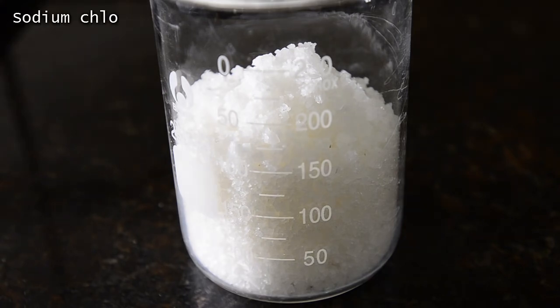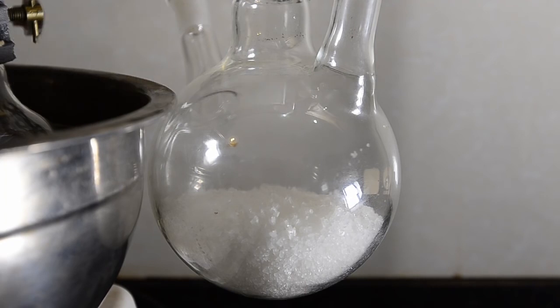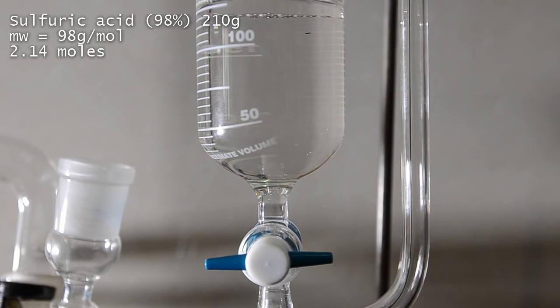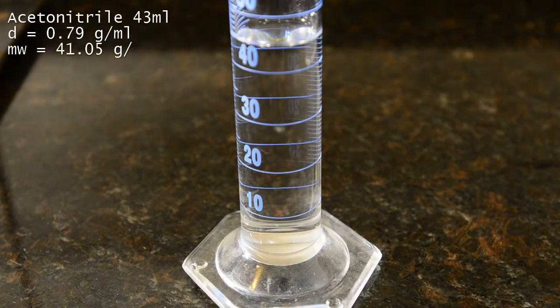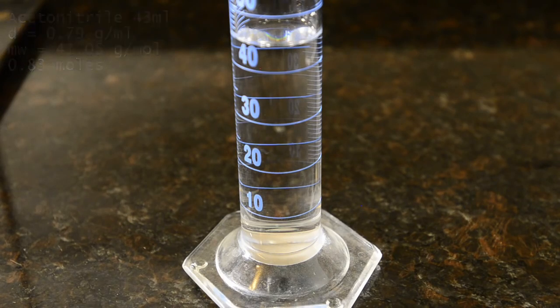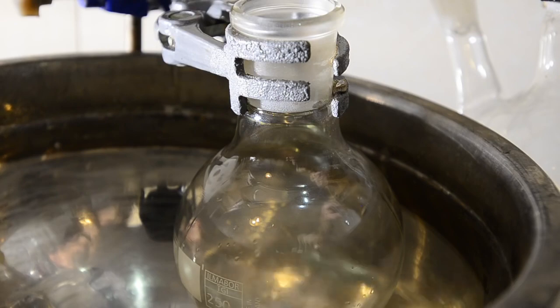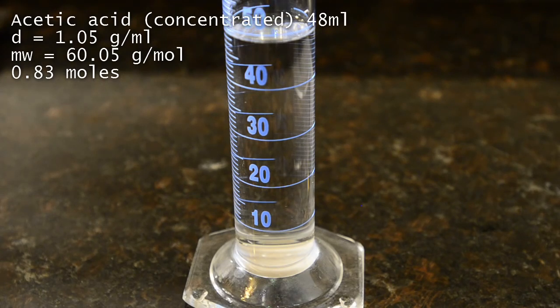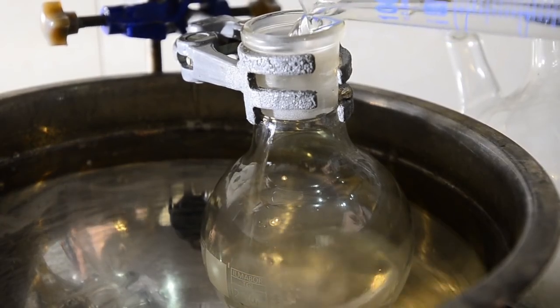First we measured out 130 grams of sodium chloride and placed this into the gas generation flask. Then we measured out 210 grams of concentrated 98% sulfuric acid and placed this into the addition funnel with the tap closed. We measured out 43 mL of dry acetonitrile and poured this into the reaction flask, then measured out 48 mL of glacial acetic acid and added this to the acetonitrile. We swirled the flask to ensure the liquids were completely mixed.